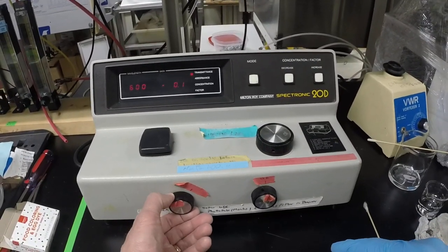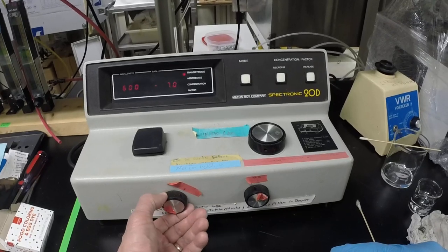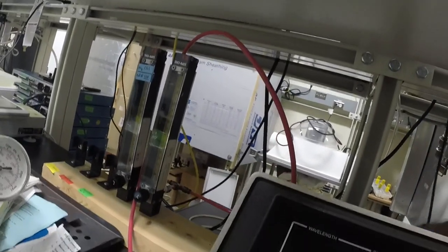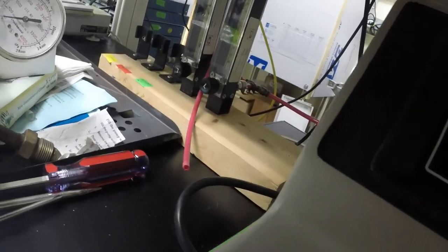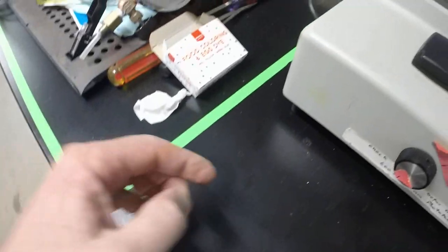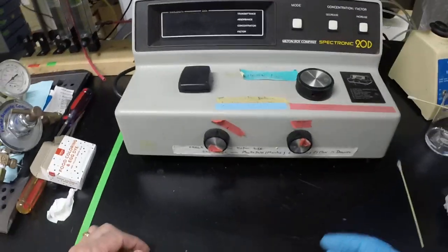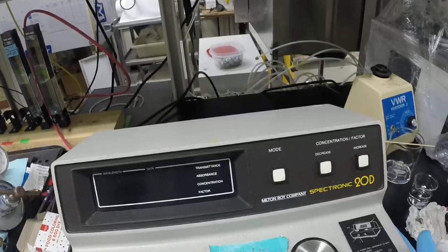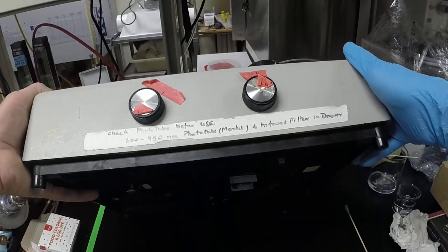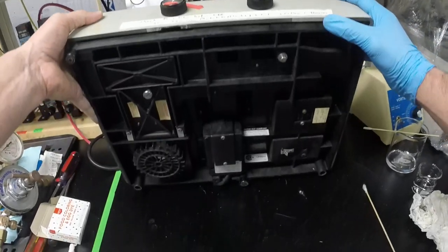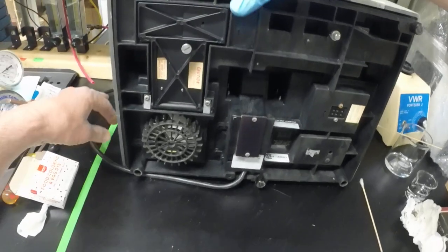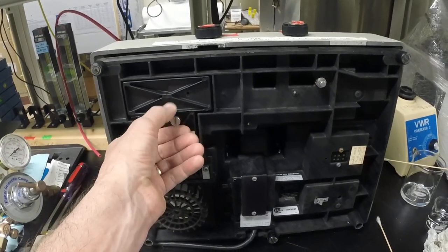So what I'm going to do is turn the unit off. The electrical outlet's on the back side. I'm going to go ahead and unplug it because I'm actually going to go inside the guts of this unit and replace the bulb, and that's done pretty simply. Tip it up on end. It's pretty stable. Now it's unplugged, so you can undo the little drawer here.